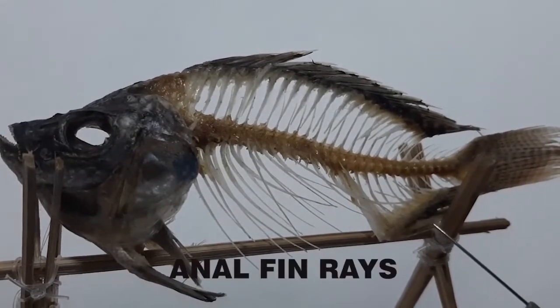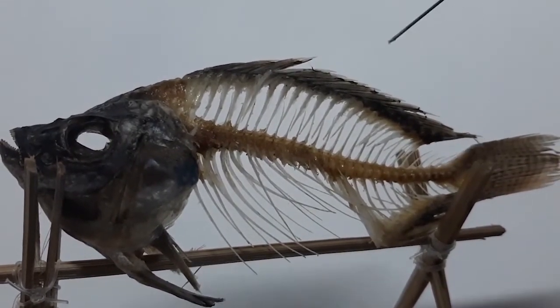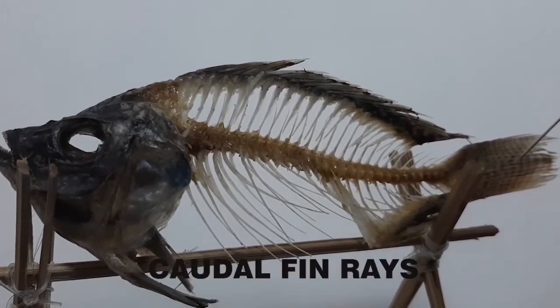This is the anal fin rays, hemal spine, neural spine, dorsal fin rays, hypural, and this is the caudal fin rays.